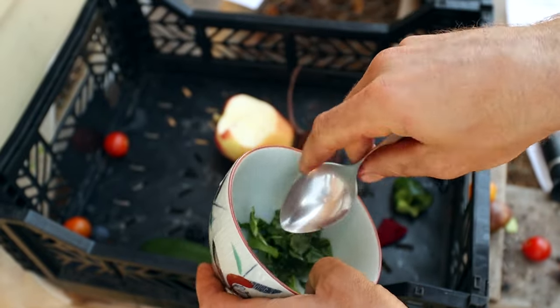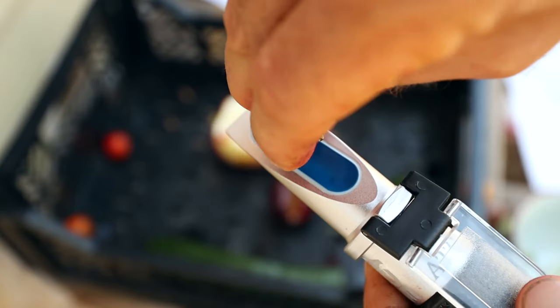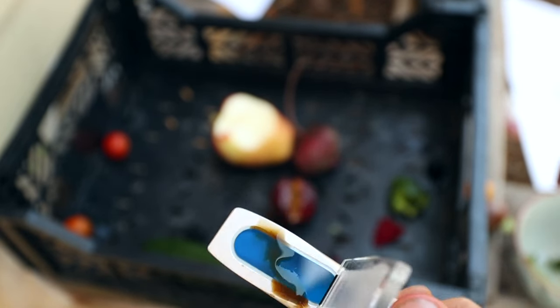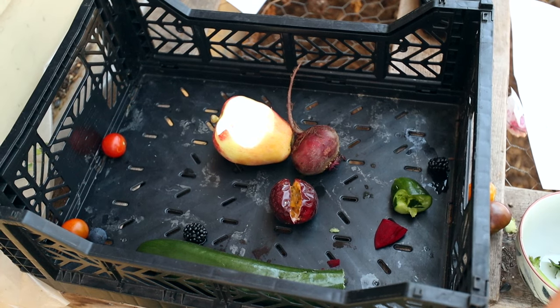I don't have a mortar and pestle unfortunately, but that would work a lot better. That's kind of a brown juice — sitting at about 4 or 5, like the lettuces. I hope that was really interesting for you — it was certainly interesting for me to see how my different veggies and fruit stacked up according to the Brix charts.